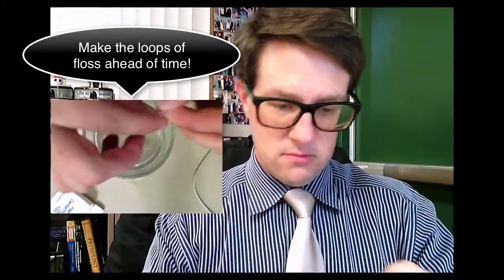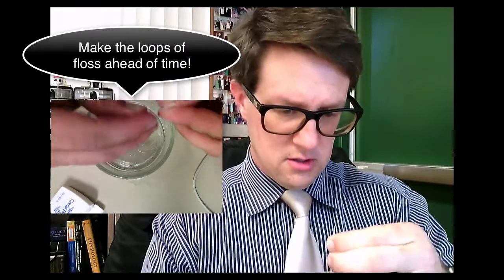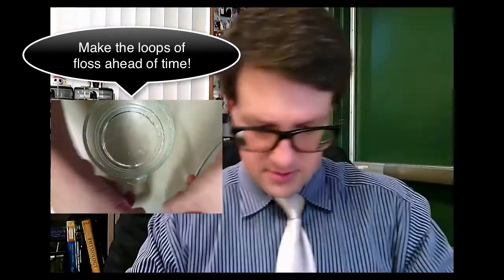All you have to do is open up one end. What I personally recommend is folding it in half lengthwise and then doing that again — pinch it down — so it's folded several times. Then take a little bit of tape. Keep one end inside the water because if it dries out it's impossible to work with, so you have to keep it wet. Use tape or dental floss to seal that end.